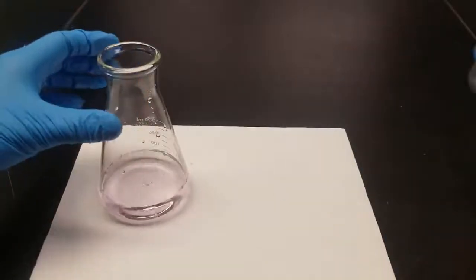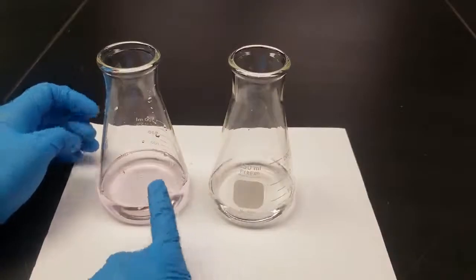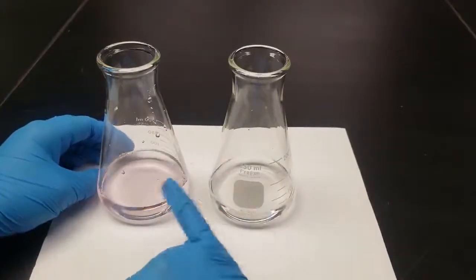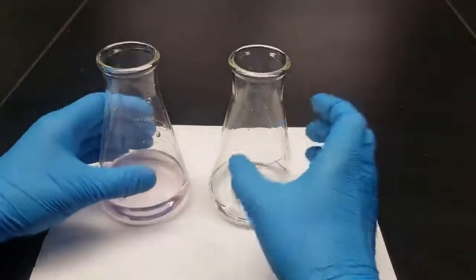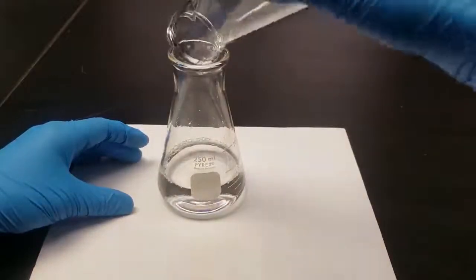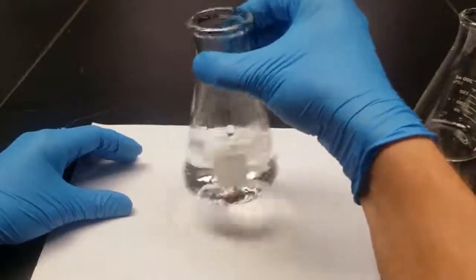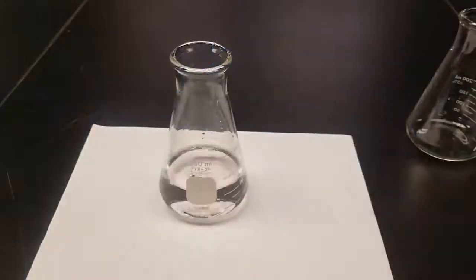And so what we'll do now is take our other solution that we did not titrate, and then we'll mix these two, right? This acid has been fully deprotonated, while this one has not. So when we mix these two together, we will have equal amounts of the acid-base conjugate salts. Mix that in there. And now when we take the pH of this, from the data we receive from that, we should be able to calculate the pKa of our unknown.